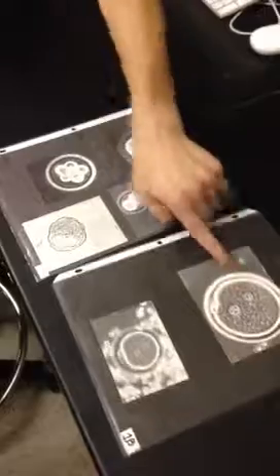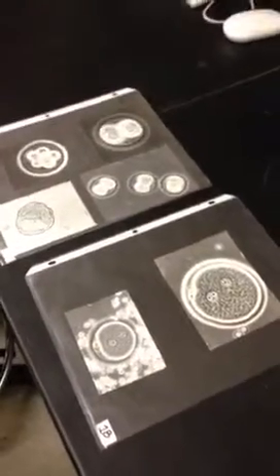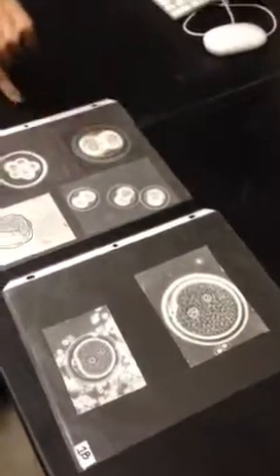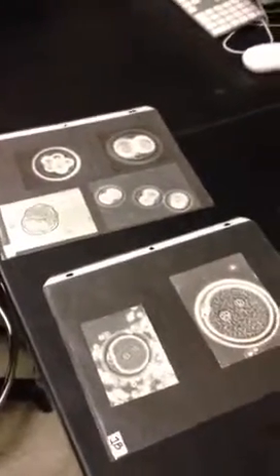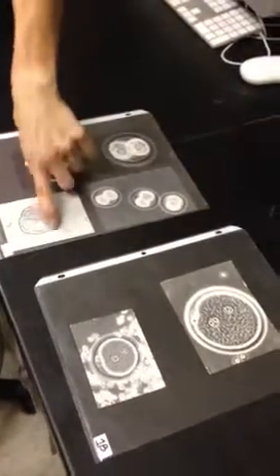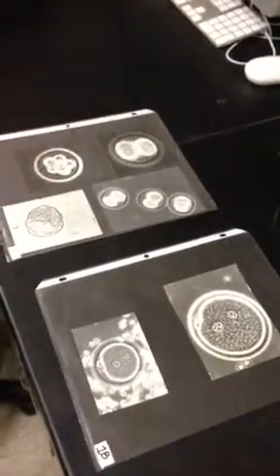So you went from one cell to two cells. This one has probably 8, because it's a ball and they're going into the field and out of the field. If you double it, 2 would go to 4, 4 would go to 8, 8 would go to 16, and then eventually you get the blastocyst where you have the inner cell mass and then the trophectoderm. So this is last. The blastocyst is what's going to implant in the uterine wall.